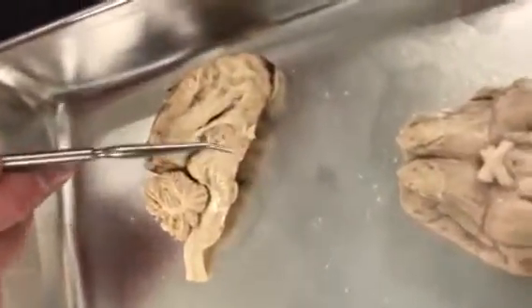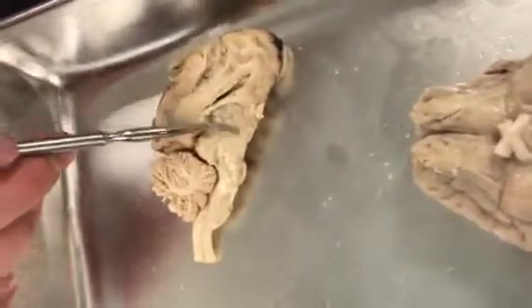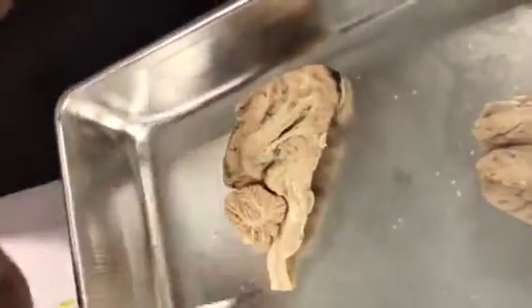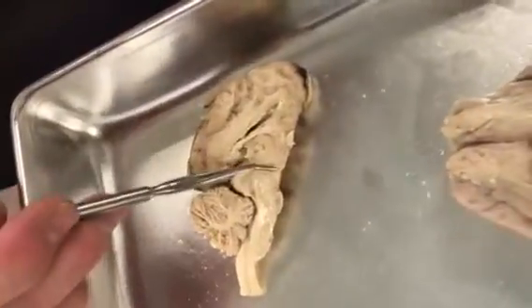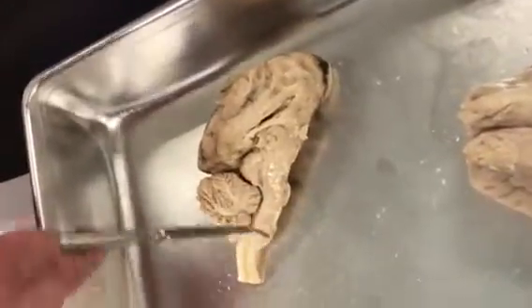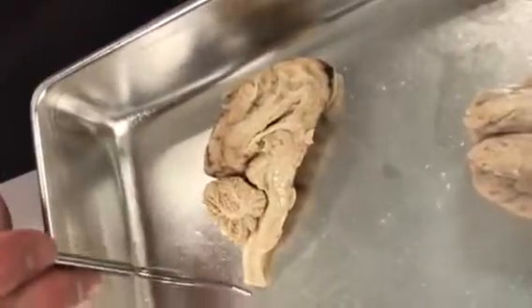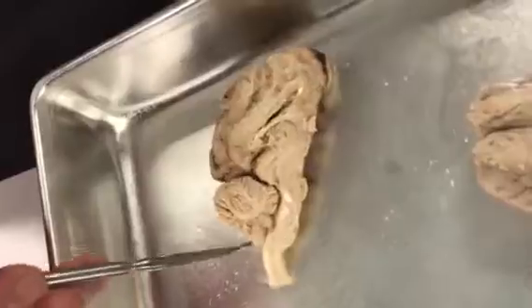diencephalon. The diencephalon is where we have the third ventricle. Kind of sits on top of it here because it's in the middle. So that's third ventricle. Down here, diencephalon, then this area is the midbrain. This here, where that bump is? Pons. Next bump? Medulla oblongata. Spinal cord.